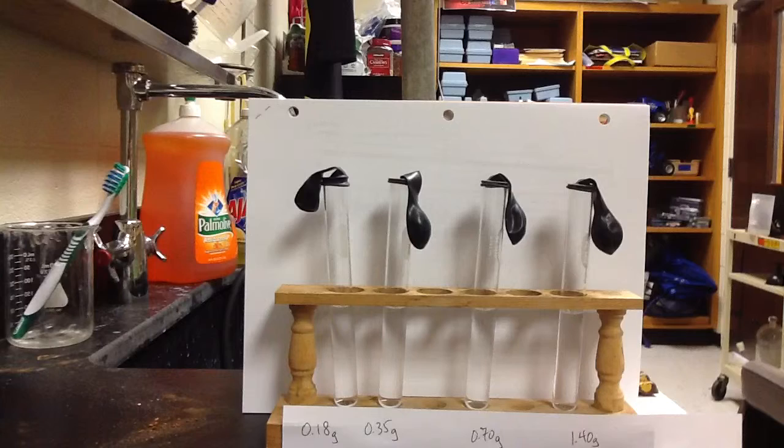As you may know, when you mix vinegar and baking soda, you make some gases. So you get carbon dioxide gas and water vapor as gas. So let's go ahead and get those mixing, and we'll talk about what we can learn from it and what happens here.